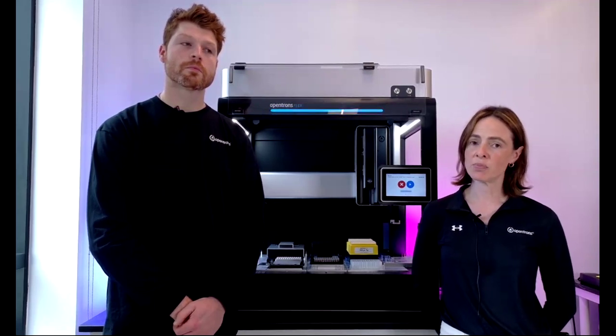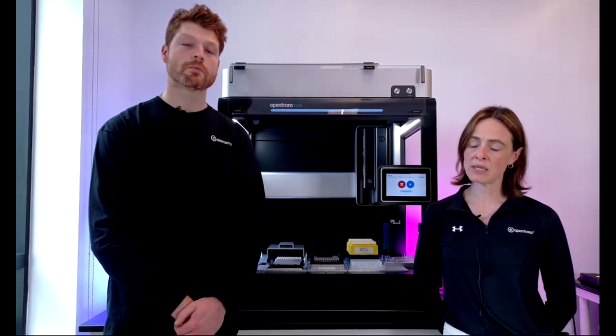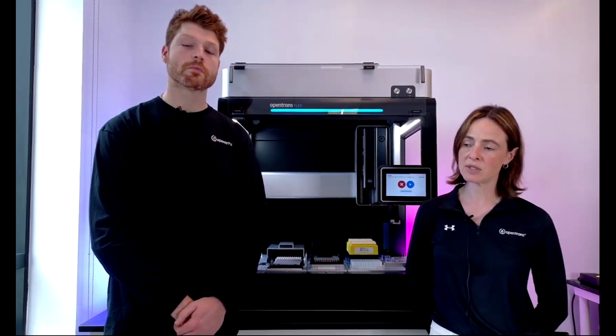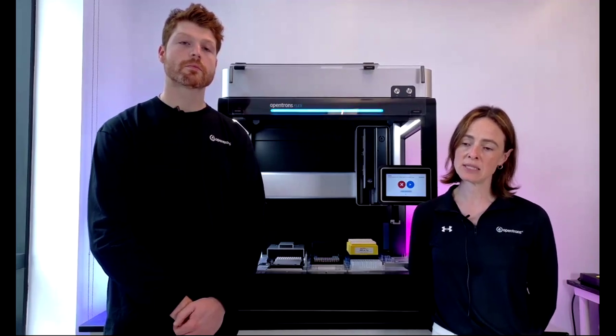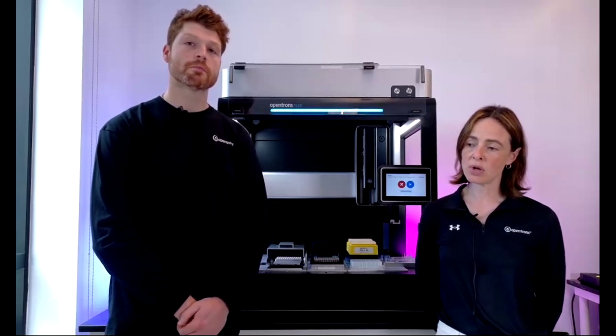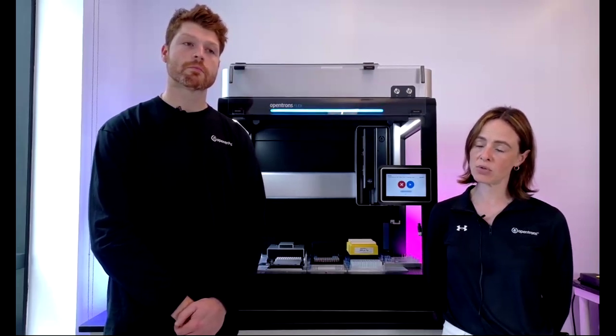I think it would go back to the particular nature of the pipetting and what would need to be pipetted. So we definitely have a lot of chemists using the robot, but we'd really need to get into detail in terms of what you wanted to pipette and how. And we could definitely do that in a call with a rep and an FAS to really go through your needs.